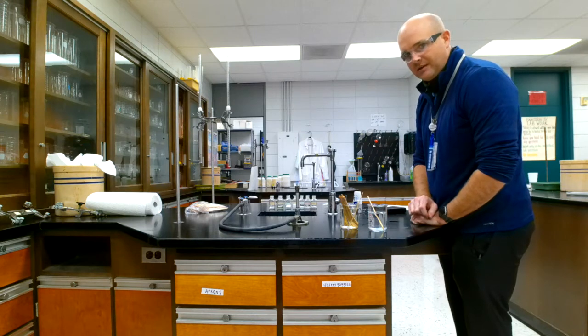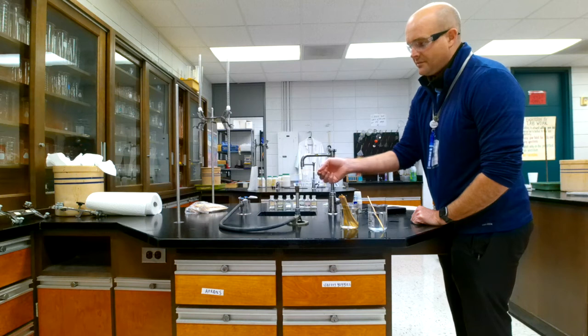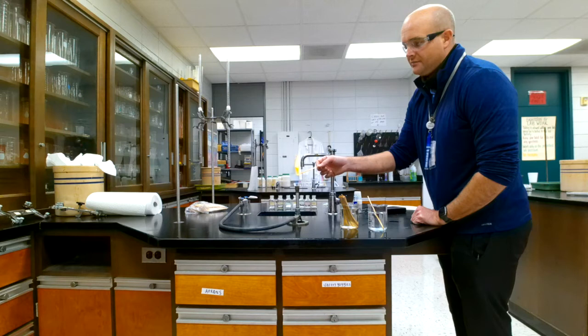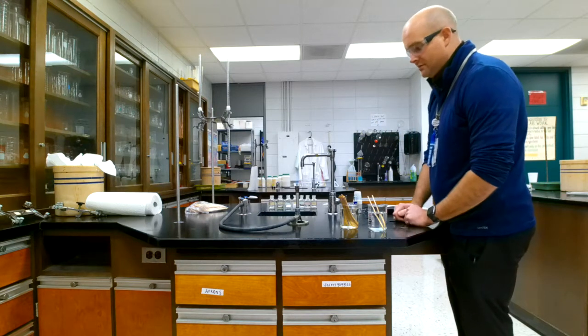dispose kit right here. So whenever I light something, I will notice the flame color, and then once I observe that flame color, see it's wet, so it's not burning yet. But even if I do light it, which you can tell it's lighting right now, I'll just place it in the water and it's extinguished. So no problem.